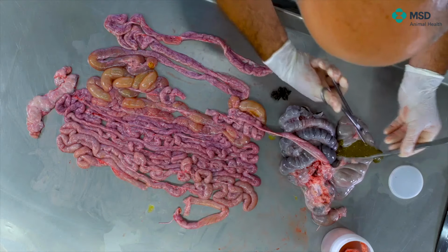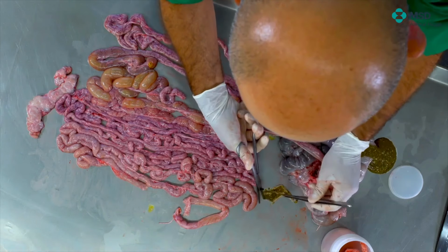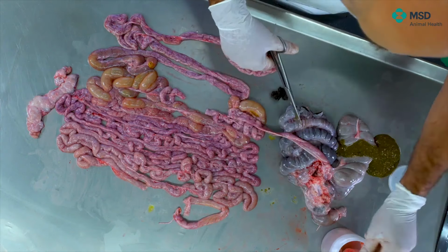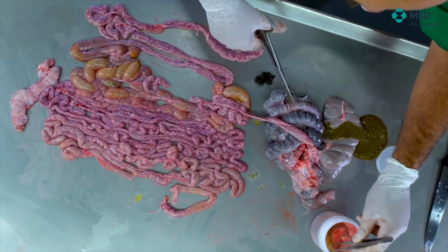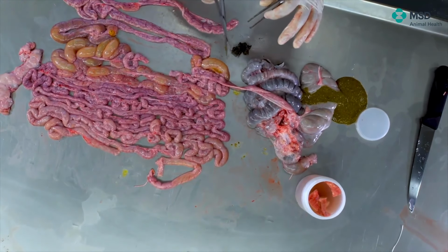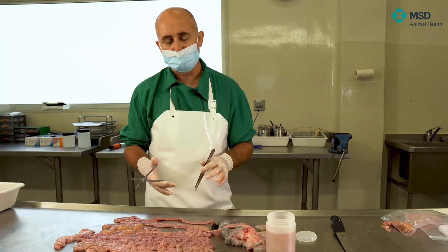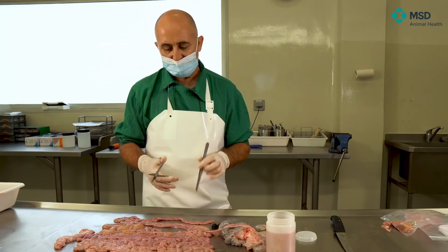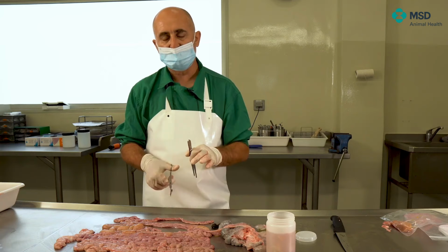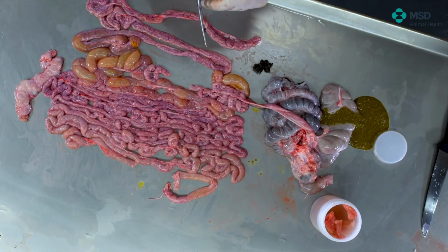Here it's easier because, being relatively liquid, we can take a part which is really not attached to feces, and we can see the mucosa. Then, when putting it within the formalin, we can move it within the formalin in order to remove the remnants of intestinal contents. And that way, we will be able to study, first of all, lesions caused by pathogens at the intestinal level, and very important, I insist, be able to identify the different parts of the intestine without any doubt.